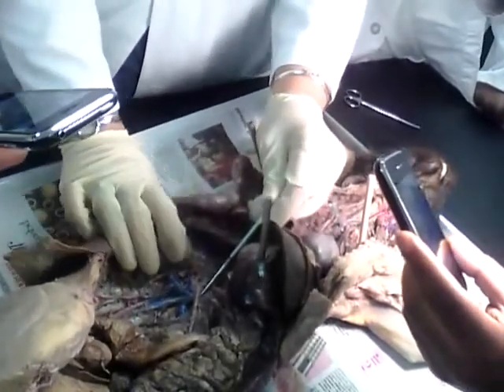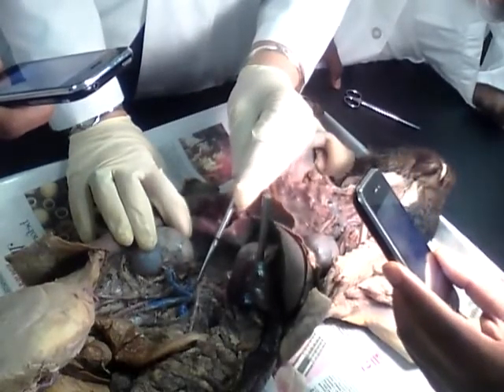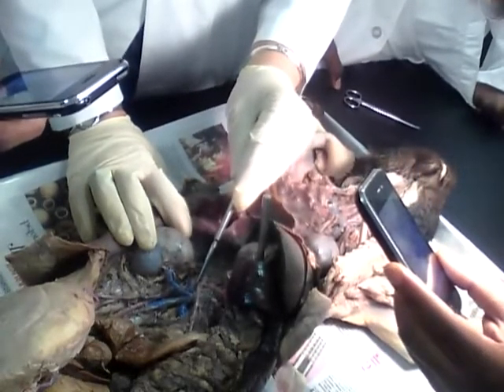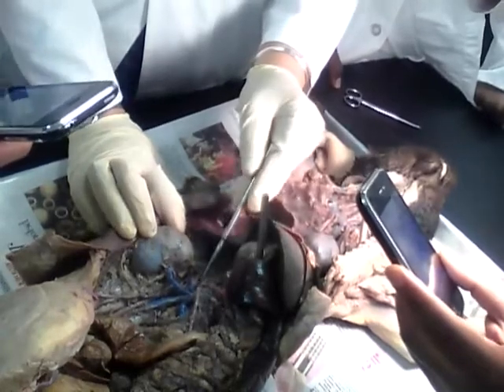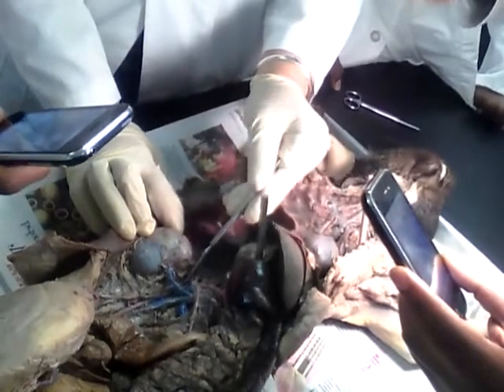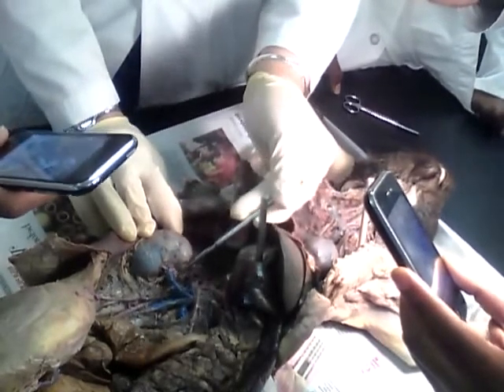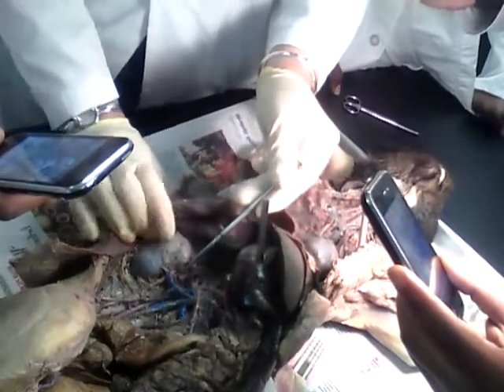Then the second branch of the abdominal aorta is going to be the superior mesenteric artery. And then it's going to find here in this little gland, it's going to be the adrenal lumbar, right? Then it's going to give me this branch going to the kidney. I'm going to call that the renal. You see how it's going towards the kidney? You have to follow it.